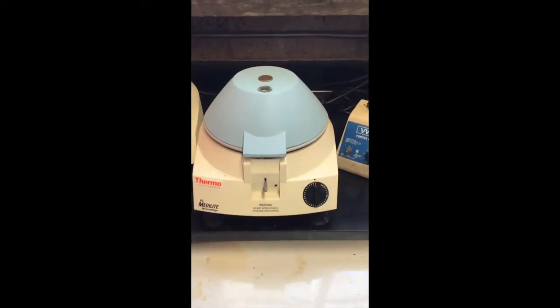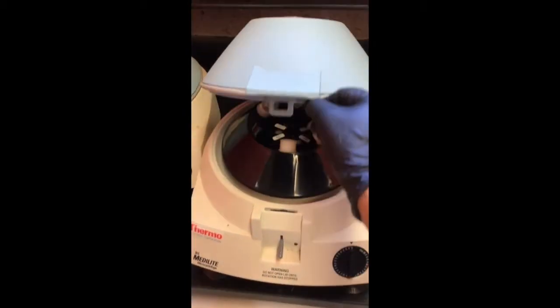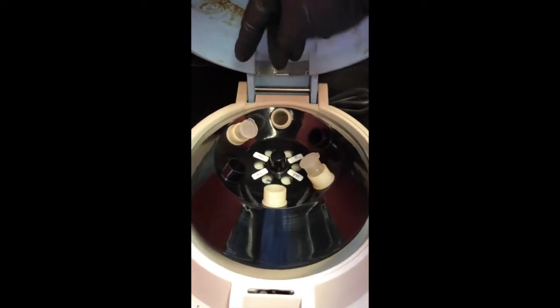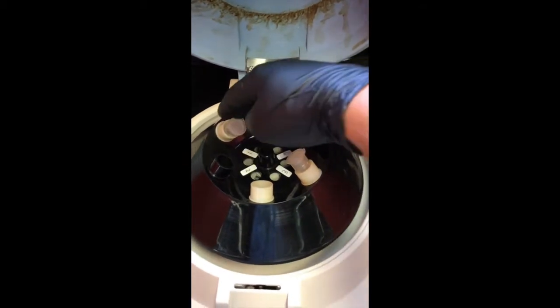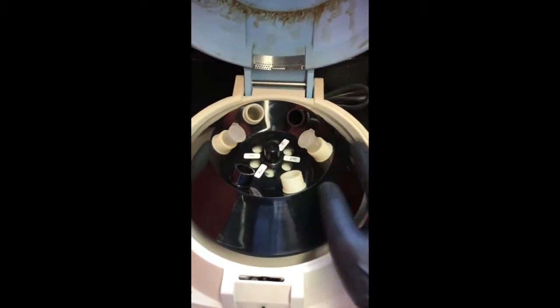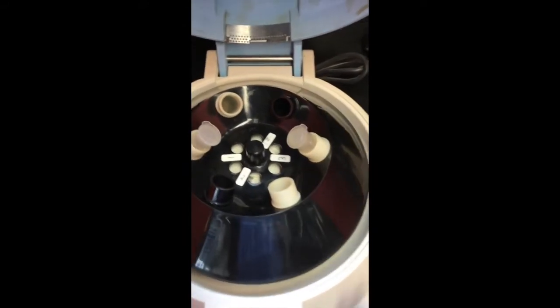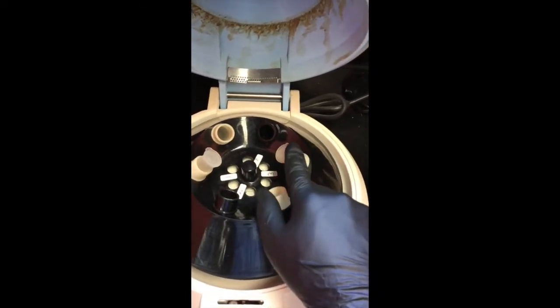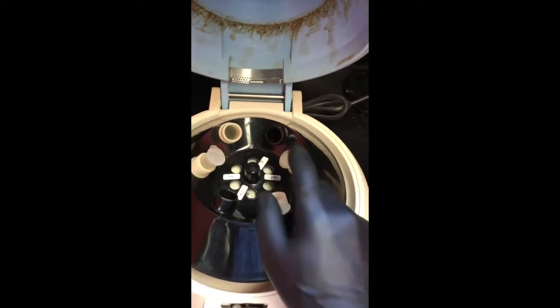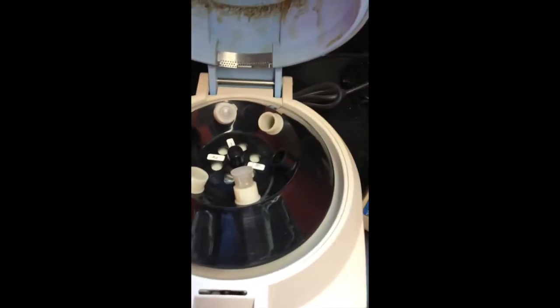All right, here's our centrifuge. And this little guy right here will open it up for you. I already went ahead and put my 2 centrifuge tubes in there. You want to make sure that when you're doing this in the classroom, it's not just you, right? So you want to make sure that your centrifuge is labeled, or whatever you're putting in here is very well labeled. And you also want to make sure it's balanced. As you can see, I have this tube, which is the same mass as that tube approximately, and they're opposite of one another. That's going to help it keep balance, so as it spins, it won't spin out of control. All right, now I can close this.